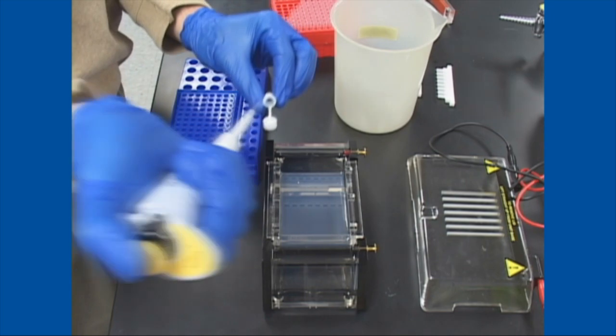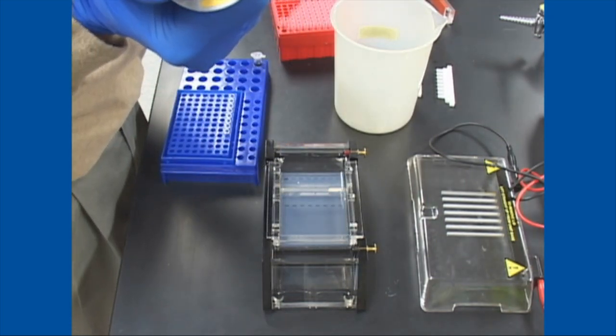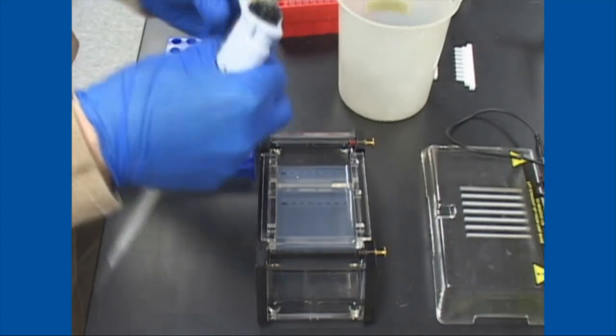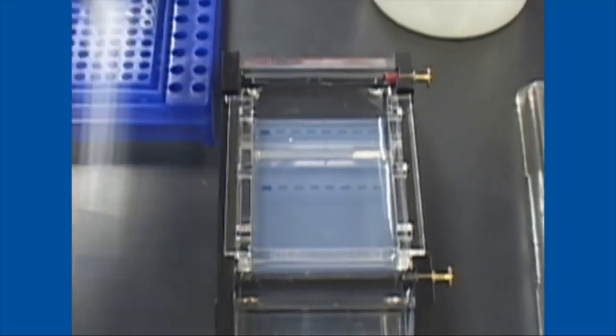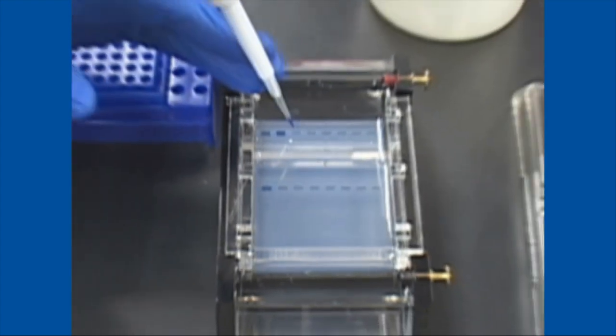Secondly, it's important to know approximately how much of your sample you will be loading. You'll want to make sure that the wells in your gel will hold that amount. If you load more into the well, it will spill over into the other wells and contaminate them, possibly giving you false results.